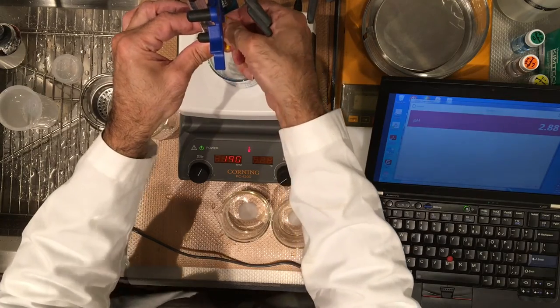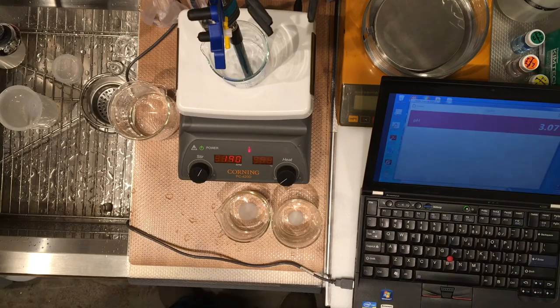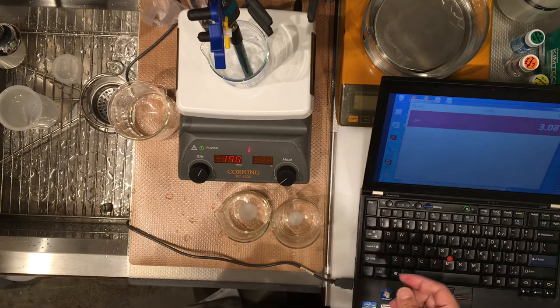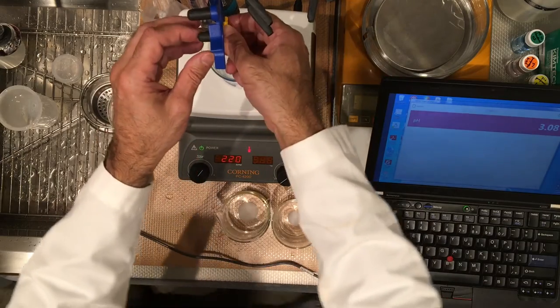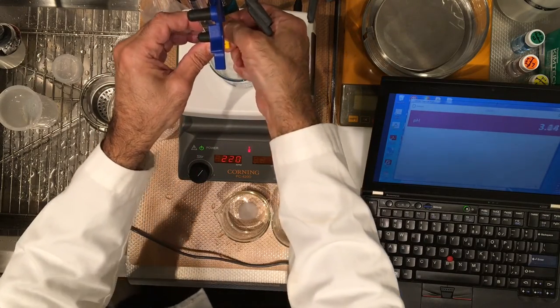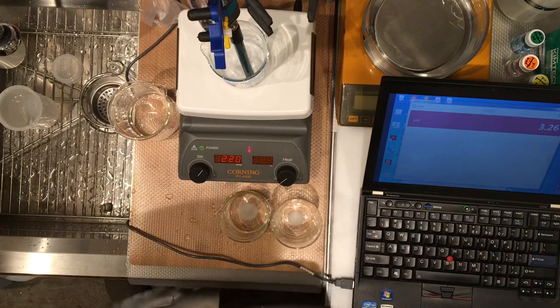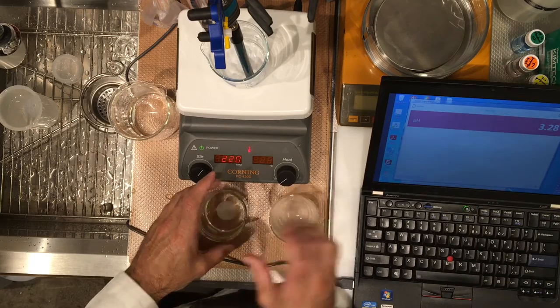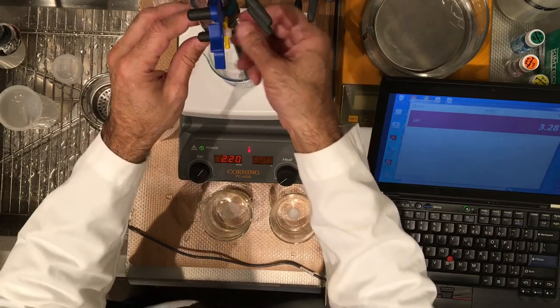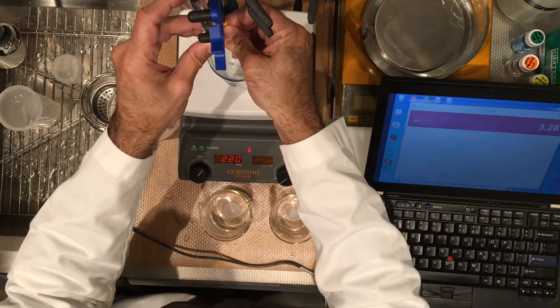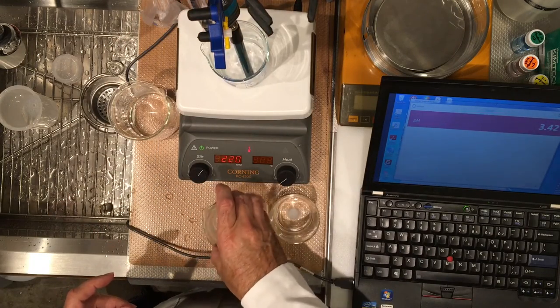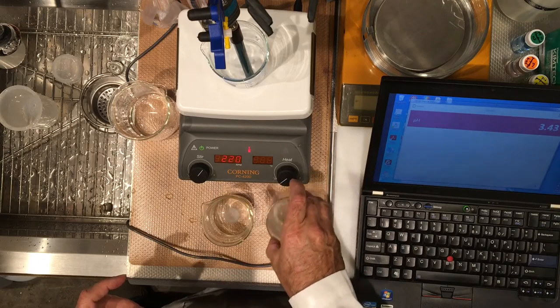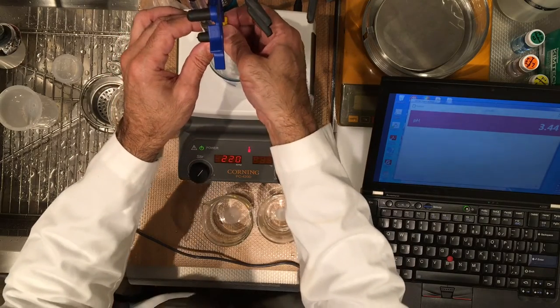So, 1.00. So, you want to record now, it's stable enough. Now adding more, 1.50. Record. Record. 2.00.